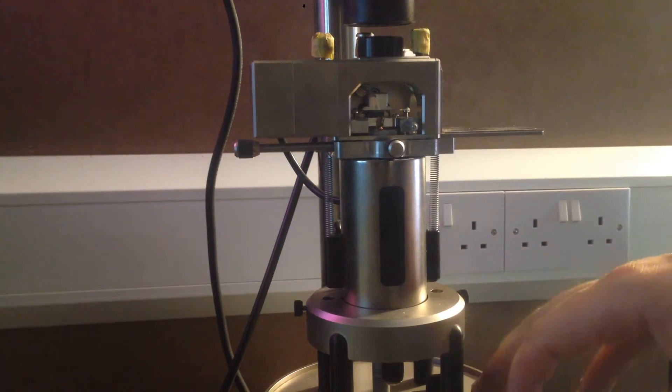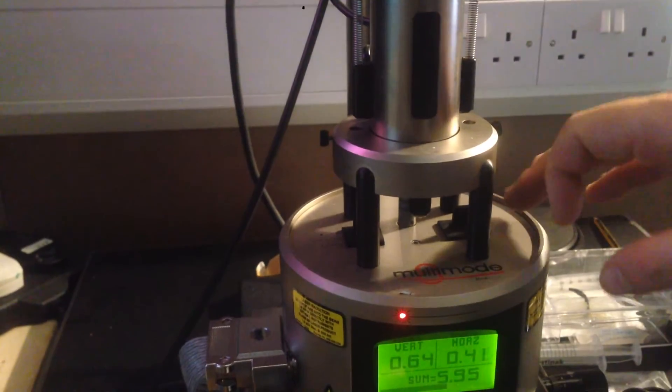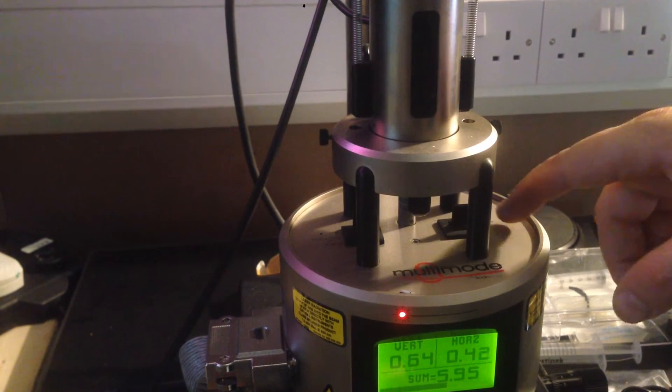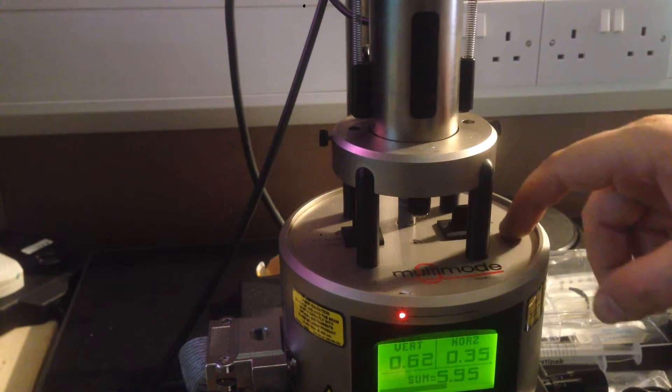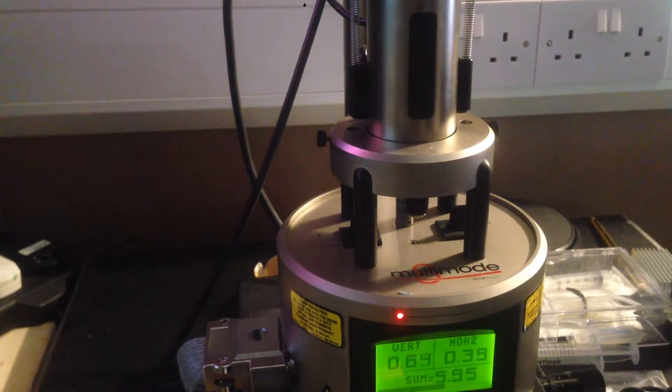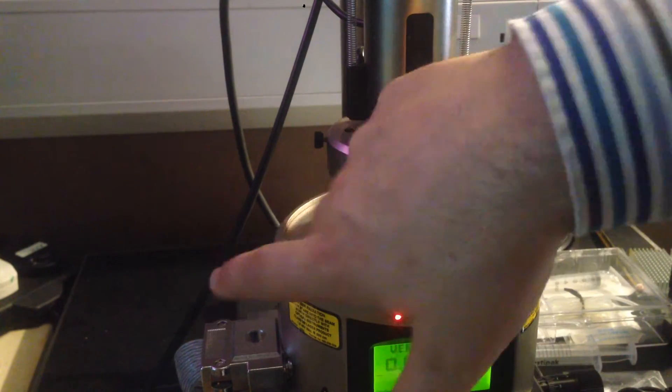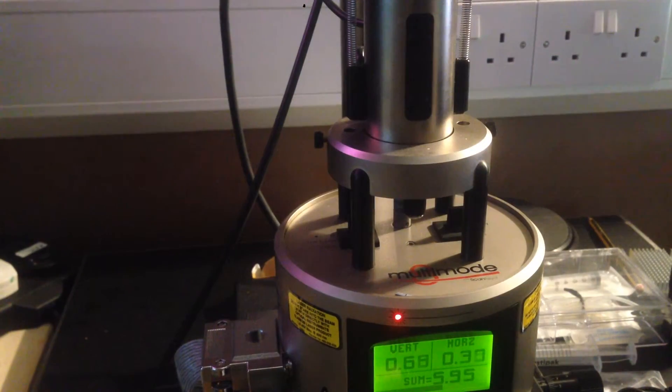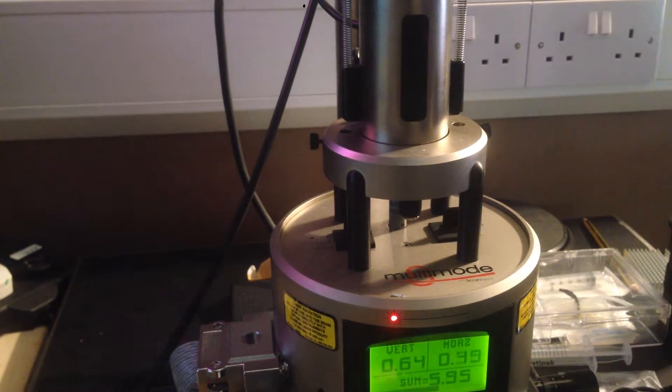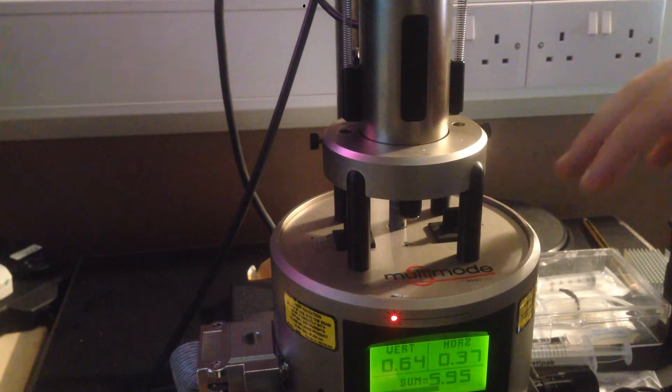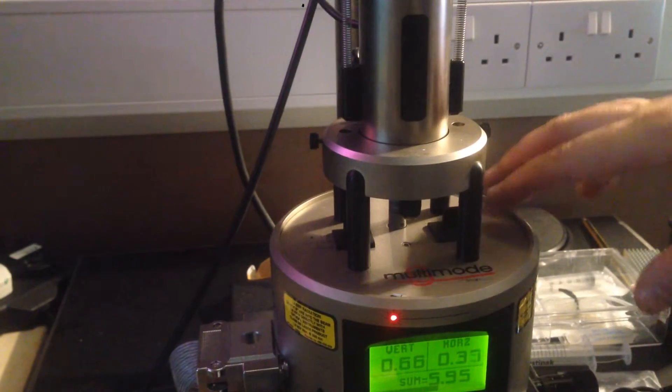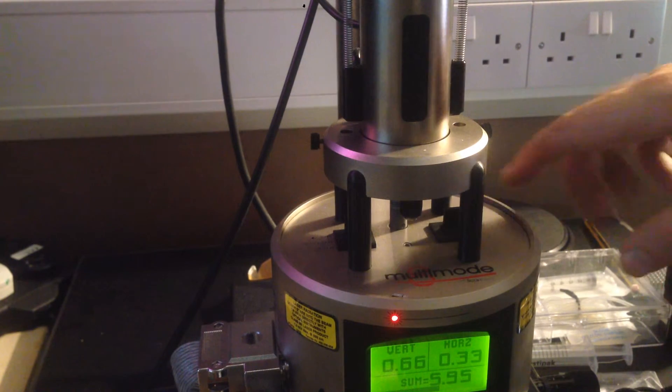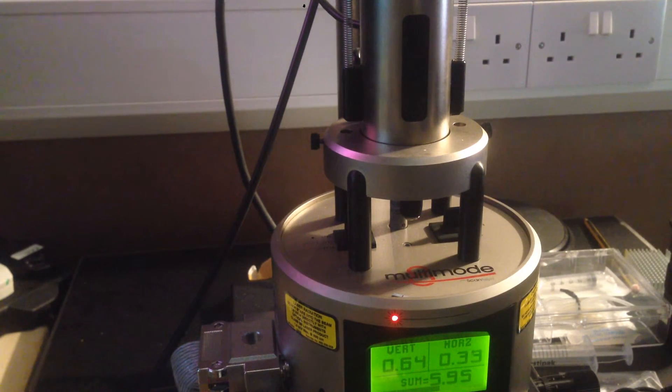The AFM has a little switch on it. Something I didn't mention is that there's a switch on the AFM and it should be in the AFM LFM position. That's probably reasonably important. There's a switch here which says down and up.